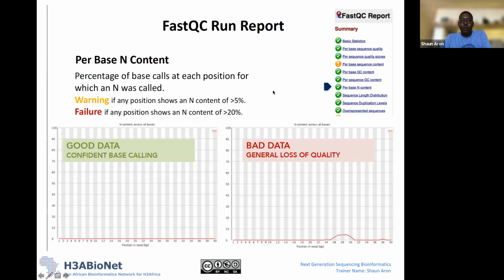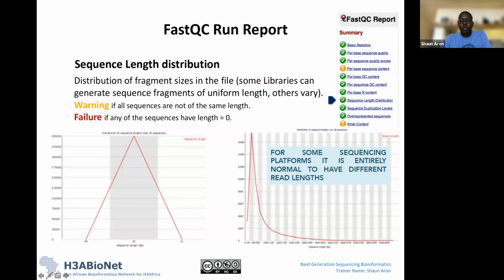Okay, so the next metric we're going to look at is sequence length distribution. This graph tells us the sequence length of most of our reads, giving the distribution of the lengths. Remember at the beginning, in our summary, we saw that our read length was 40 bases. So what we expect in this data set is that the majority of our reads should be at least 40 bases. We will obviously have some that are less and some that are more; that's just the nature of the experiment. What we should see for this plot is that for the majority of our data, our read length is 40. And this is exactly what we see here.